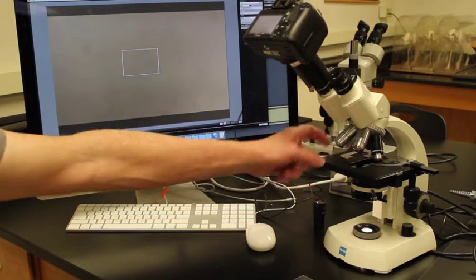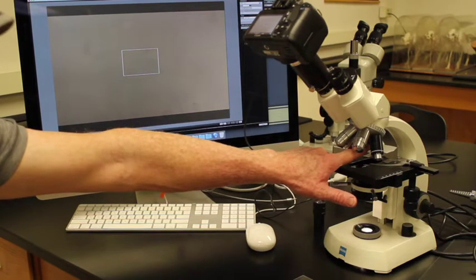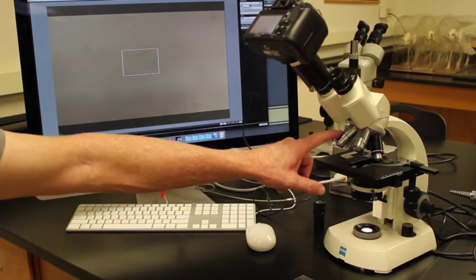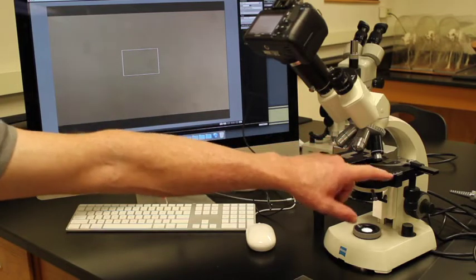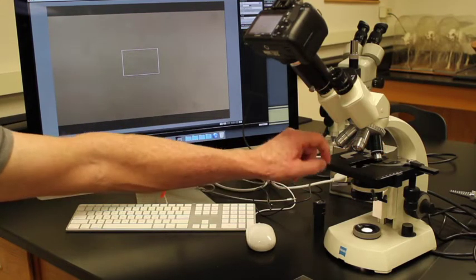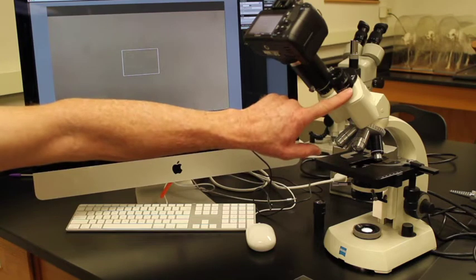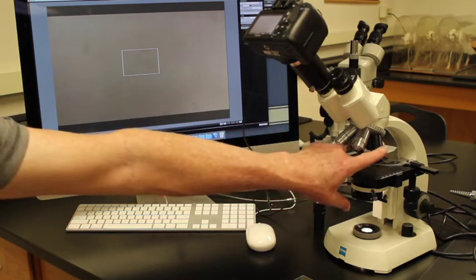Here we have various objectives. We have a 4x objective now in place. We always want to start with our lowest magnification because it's easy to move things on and off the stage. We have a 10x objective, a 40x objective, and a 100x objective. With a 10x ocular and a 4x objective, 4 times 10 is 40x total magnification.